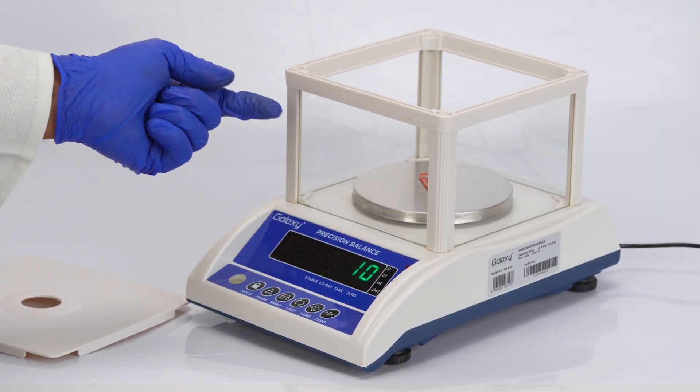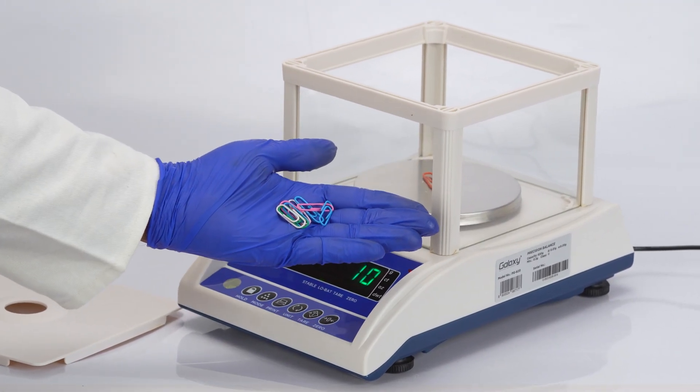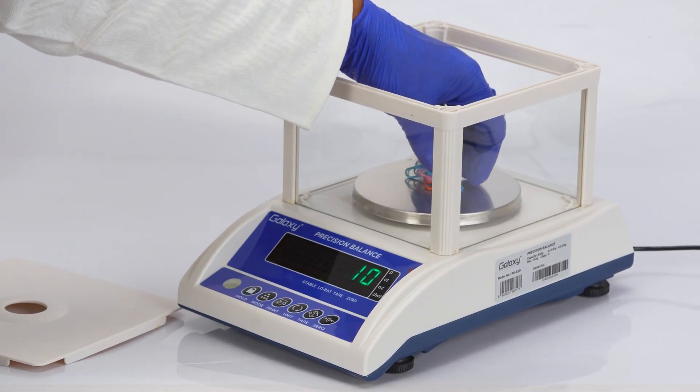The balance is now ready for piece counting. Finally, add the total pieces to be counted.